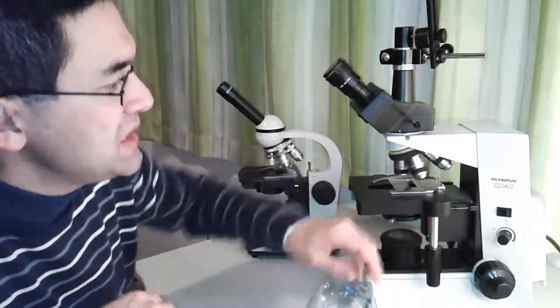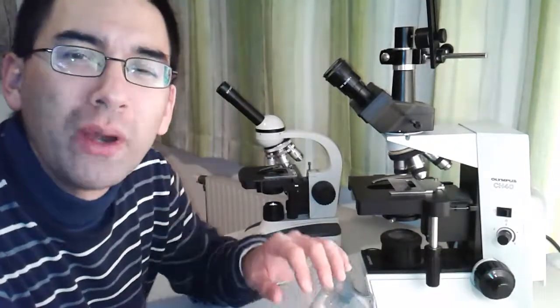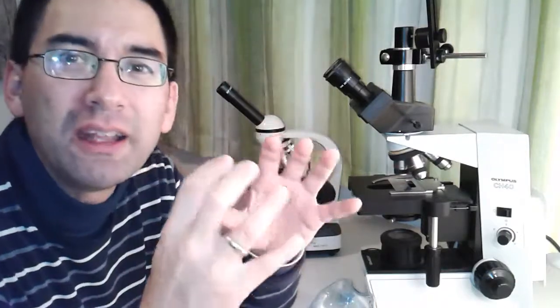The biggest enemy of the microscope is dust. Dust is a problem for a variety of reasons. Of course, it not only disturbs the image quality when you make a picture, but it can also be harmful for the optics, because when dust collects on the optics and on the parts, then when you clean the optics, the dust might scratch the surface. And also, over the years, when dust collects, for example, in the gears of the microscope, in the focus knobs, and so on, then there is oil in there, and this will solidify and make the focus knobs difficult to turn. So dust is a problem for many reasons.